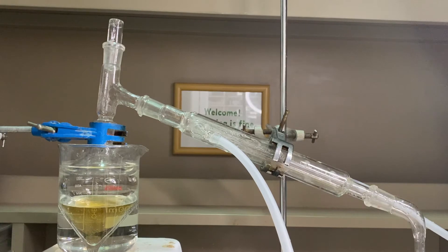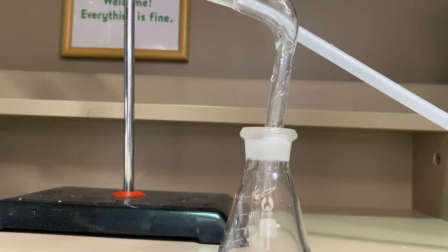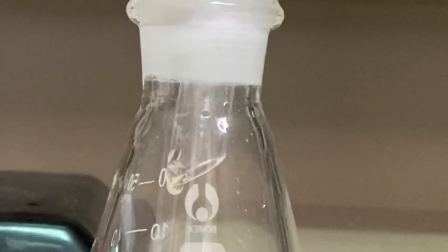So to purify our product, we ran a simple distillation. This time, the product collected is a lot clearer.